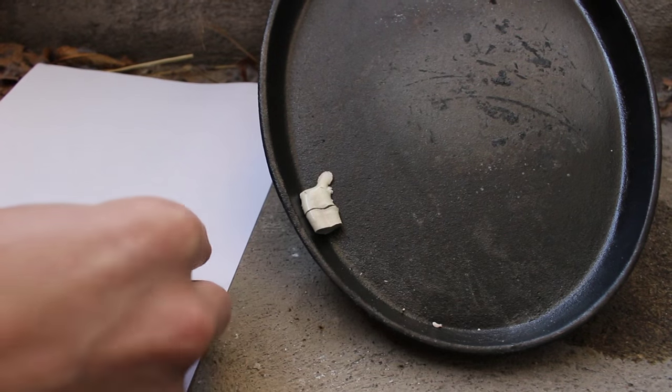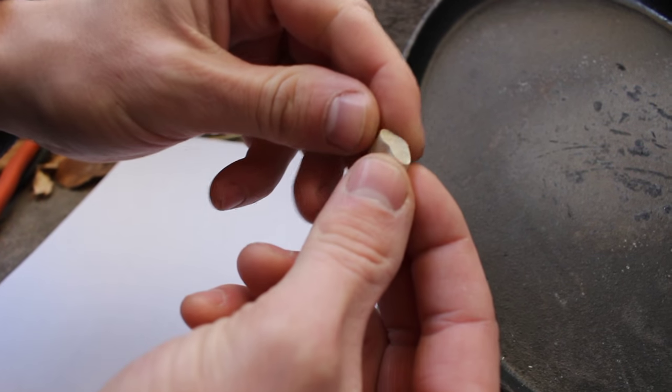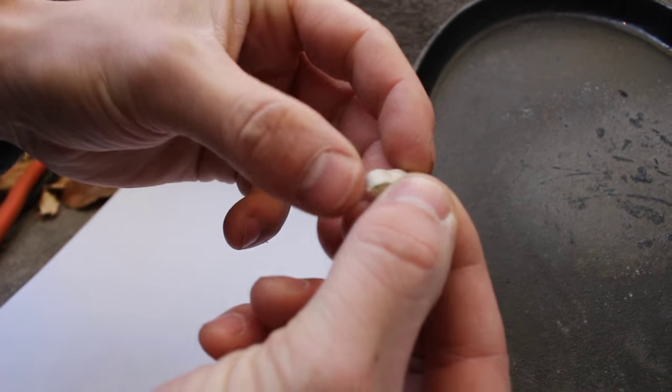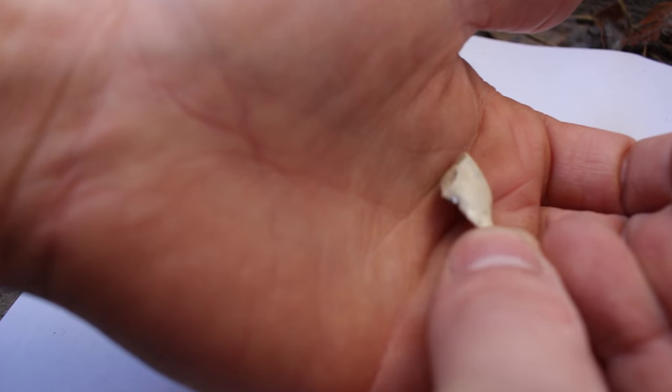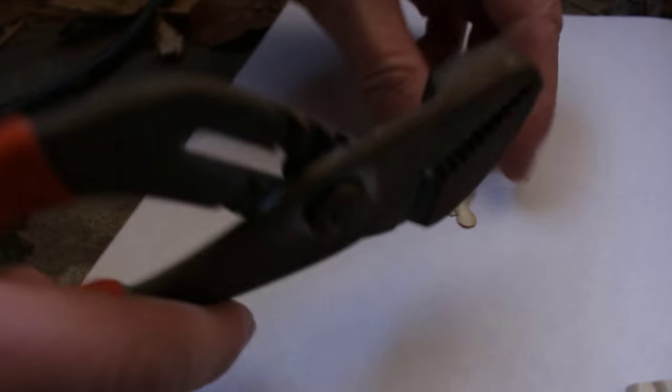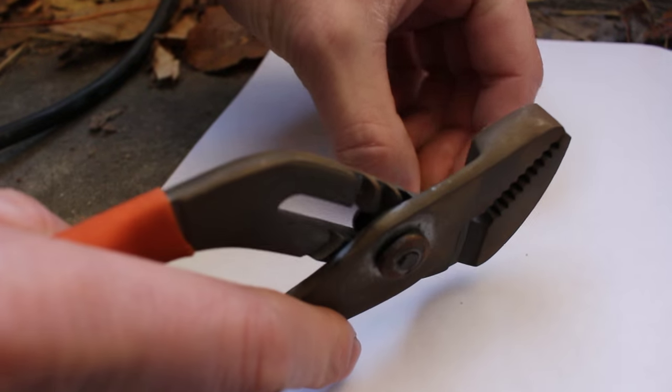As it cooled off, it broke into several pieces. Let's take these out. It doesn't look like these pieces have any lead in them. Maybe there, but I'm not sure. But this piece definitely has a chunk of lead in it. You can see the nice shiny bead of lead. Let's break it out of this so that we can actually see the thing without the flux attached to it.